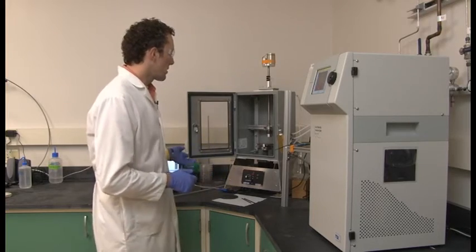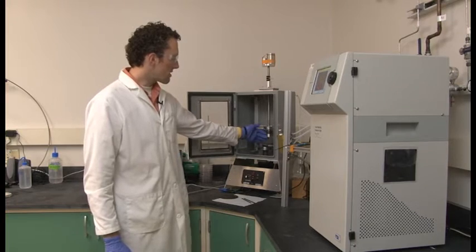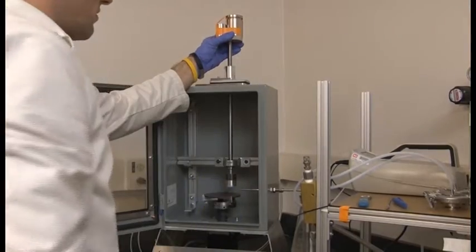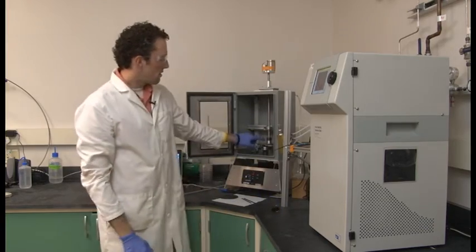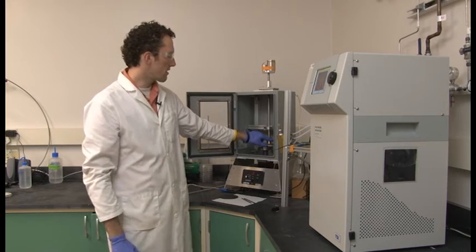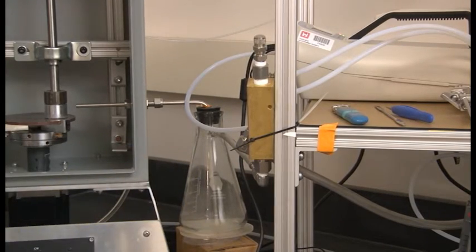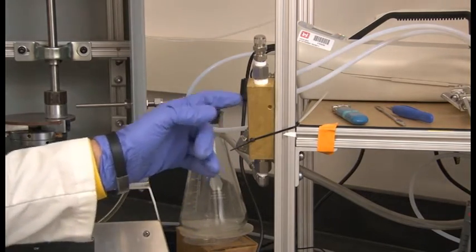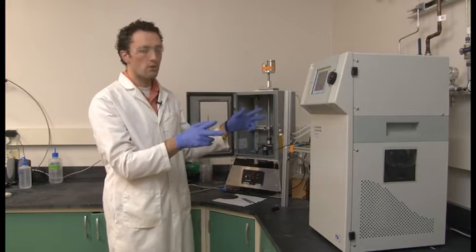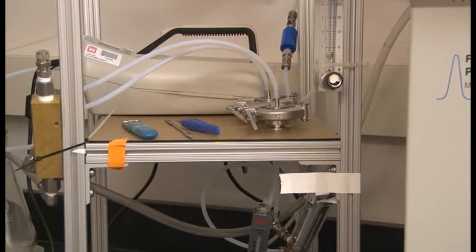So this is the chamber. Inside we have a motor that spins the sample, and the sandpaper that's attached to this arm that we can lower onto the sample. Next to the sample we have the inlet where we pump the material out during the abrasion. That goes over here to an impaction chamber where the large particles are knocked out. After the impaction chamber, the particles pass through a four-way splitter, and that distributes the samples to the two collection instruments and the two filters that we use to analyze the materials after the abrasion.